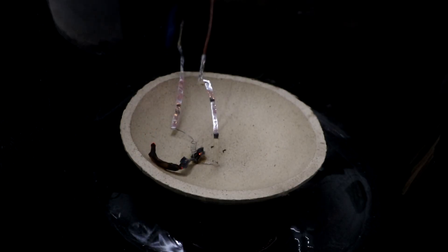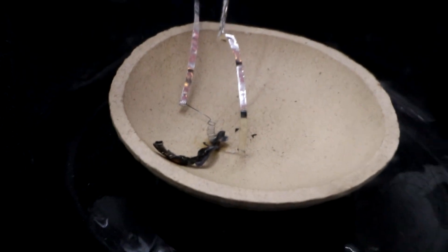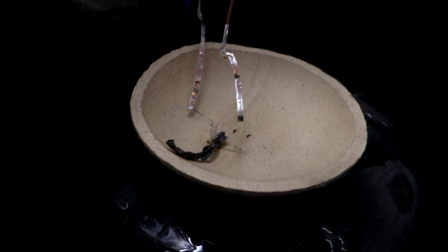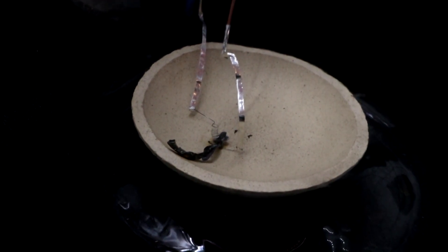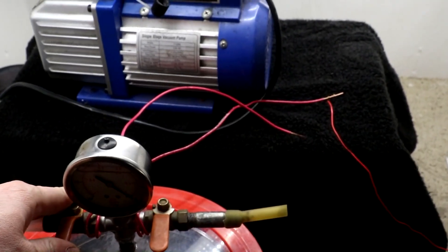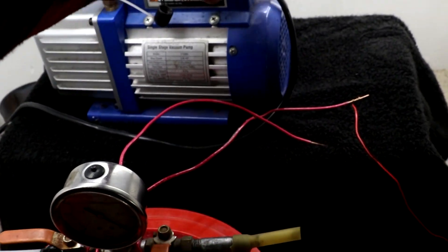It's gone, a little bit of carbon left but the flame is now out. Now let's try this again in a pure oxygen atmosphere. Of course, to get pure oxygen I will first have to remove the air.